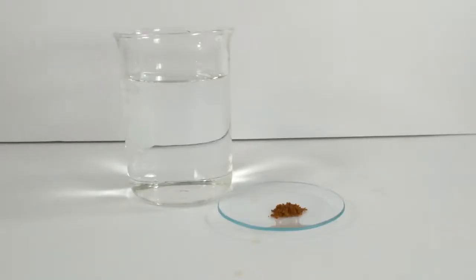The sodium salt dissolves quite easily in distilled water, and like any dye going into solution, it's a spectacular sight.